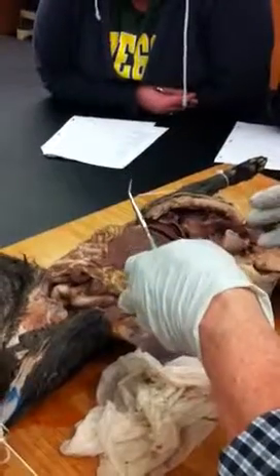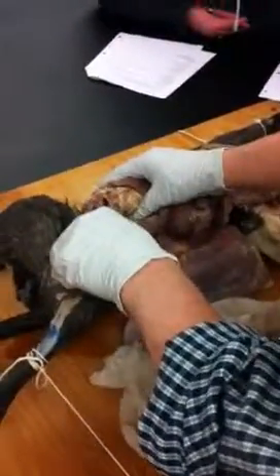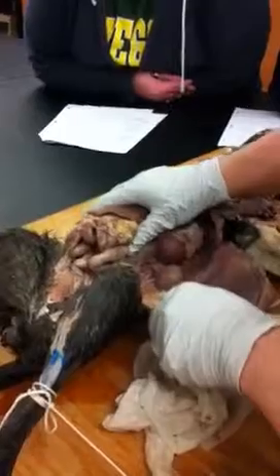Abdominal pelvic cavity. Okay? And that's significant because it means that in order for me to actually expose the vessels, I have to tear apart the peritoneal lining here. So the vessels are that way too. So I've basically torn this open so you can see that the kidney is a very common, very large structure.